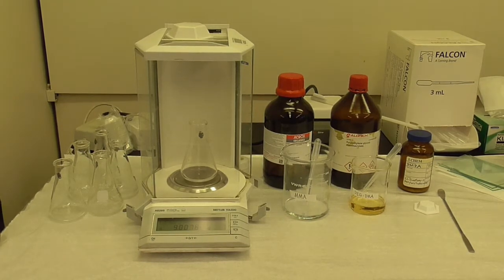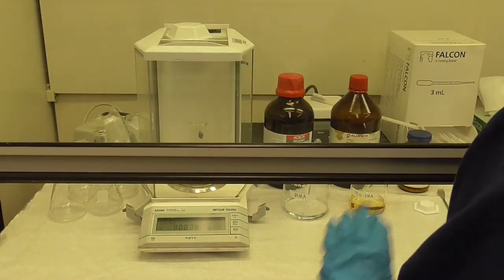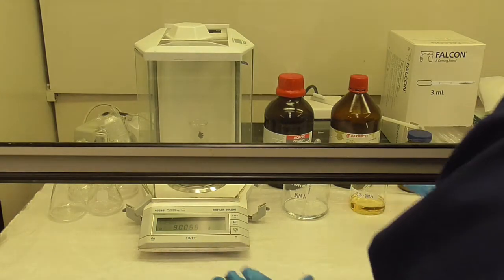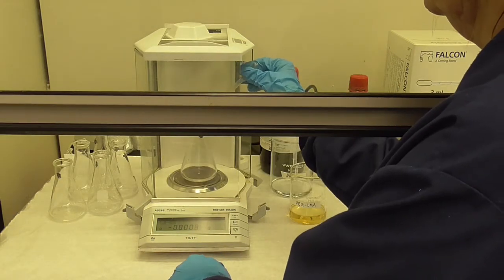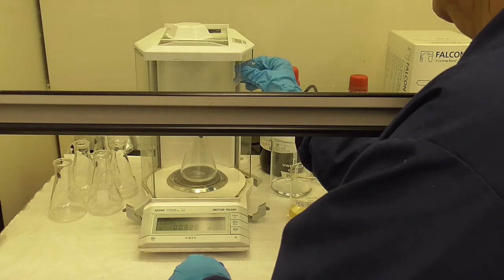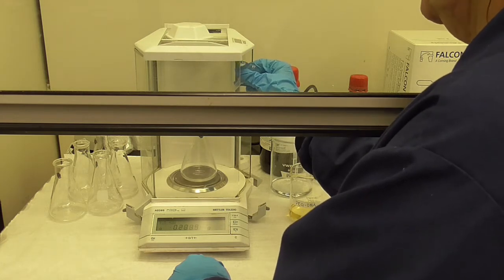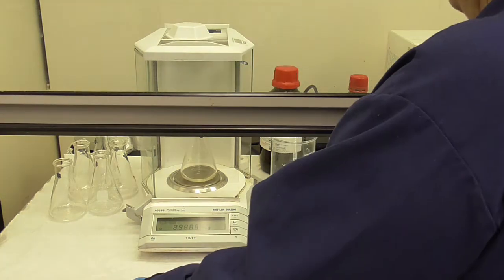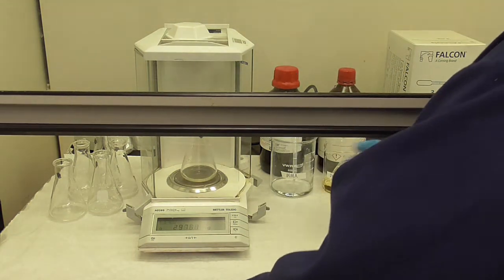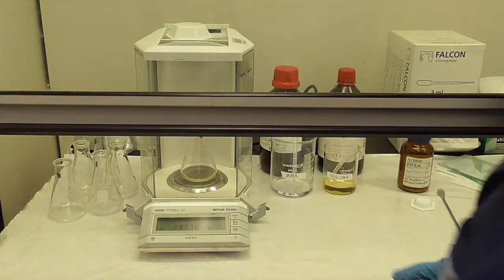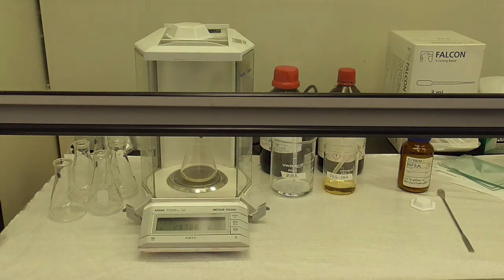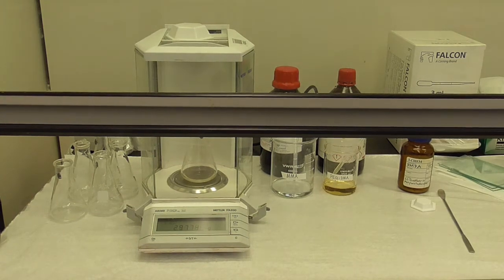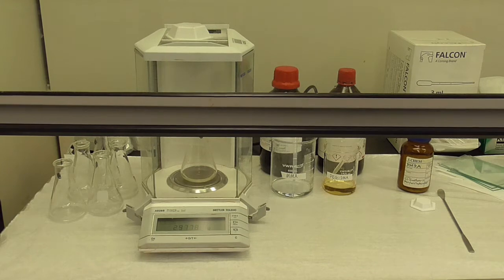Now I need three grams of the PEG. Write down in your notebook what actual mass you weigh out.